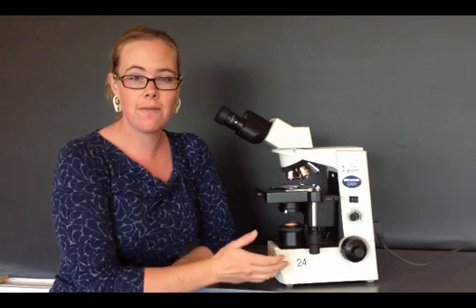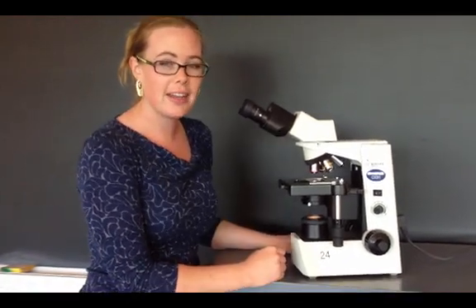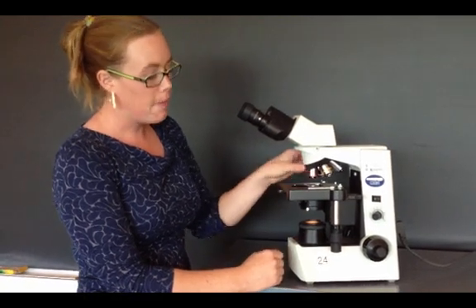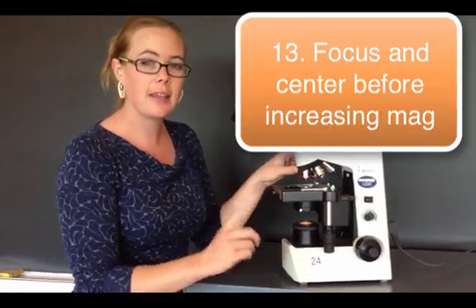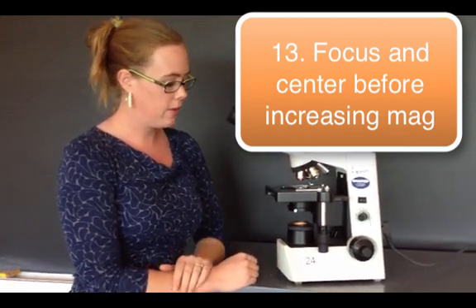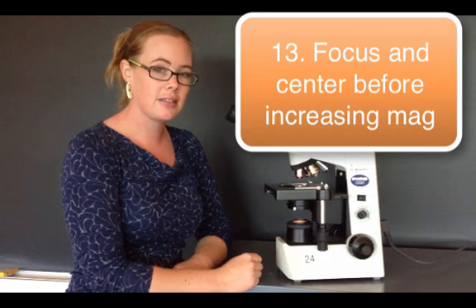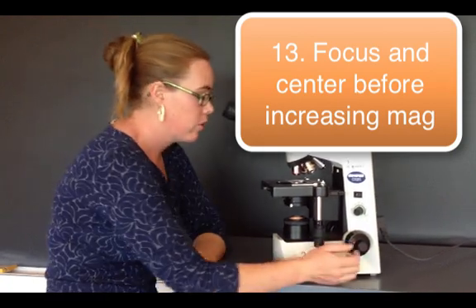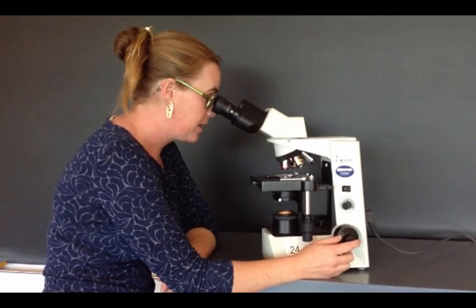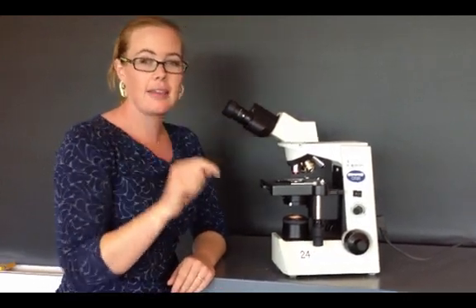Now, the microscope is in focus and adjusted for your dimensions. When you're ready to increase magnification on your specimen, make sure that it is completely in focus before you increase the objective. Then, the second thing is to make sure that when you're looking through your microscope, the specimen is exactly in the center.